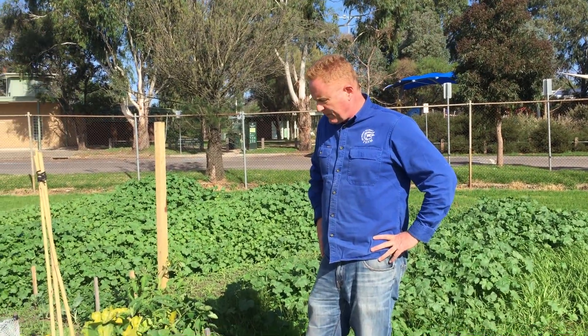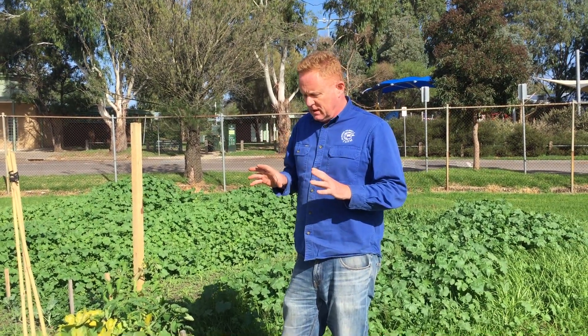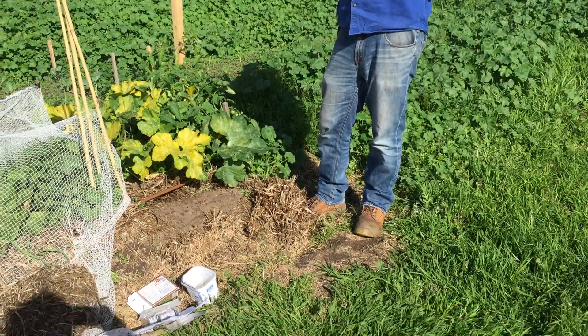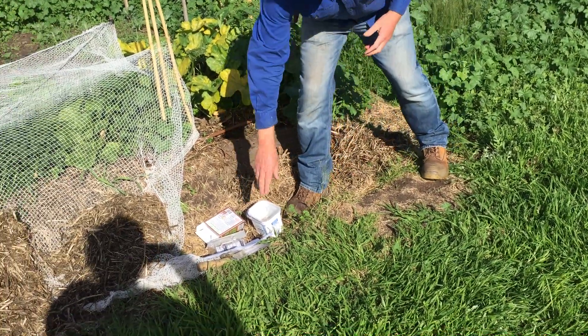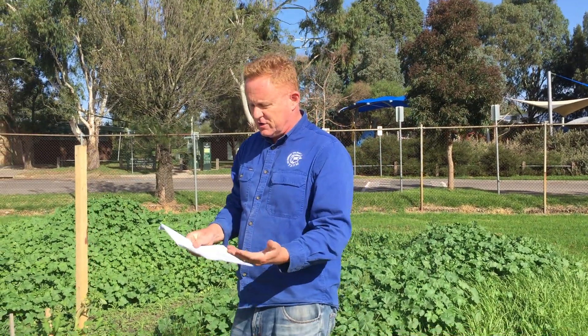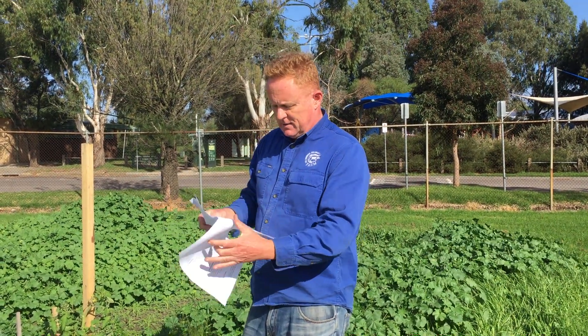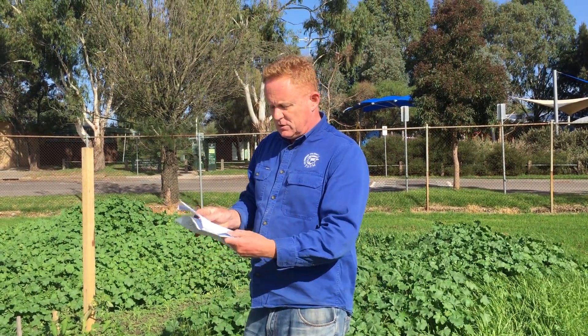We're down at the southern end of the plots and we're going to use the pH test kit as per the prac — the digging deeper prac sheet. It covers a few things: plant nutrition and some other things I'll talk about in another video, but we're going to focus on pH, always written with a small p and a capital H.